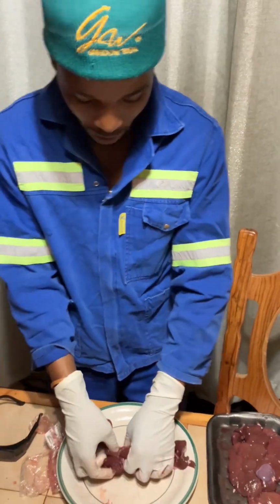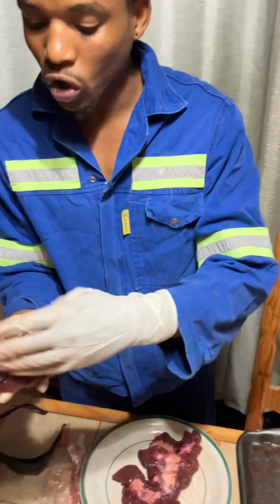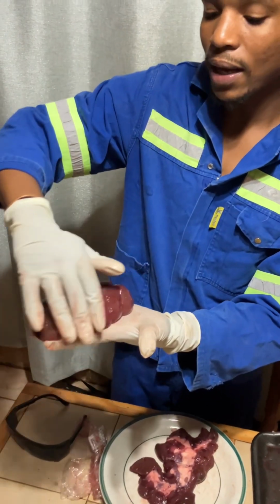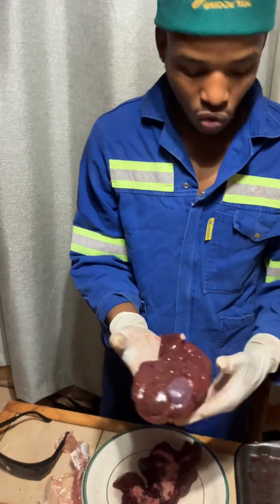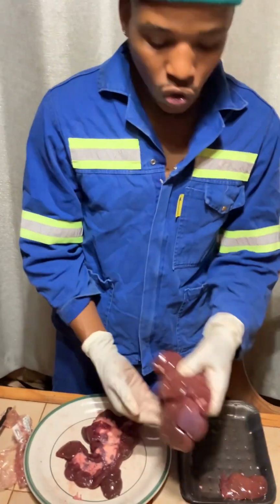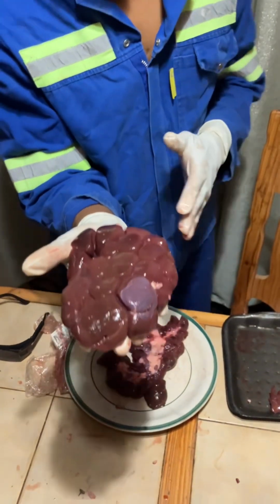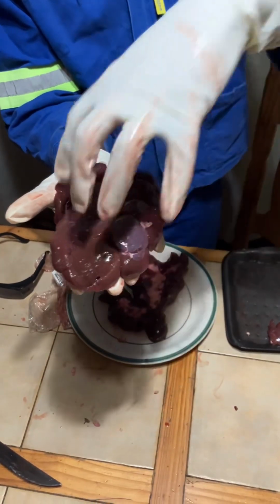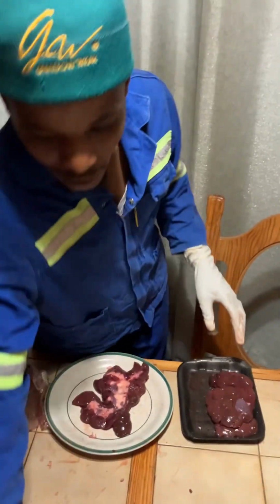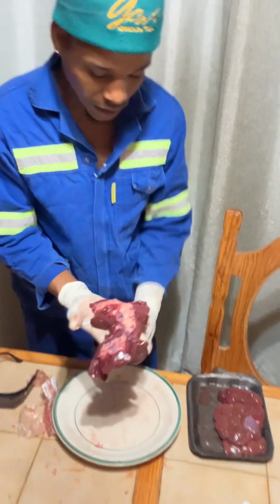All right, now the most outer layer part of the kidney is called the capsule. The capsule is the most outer layer part of the kidney and is also the one that gives the kidney stability. The capsule also protects the kidney from any possible injuries. So it's the one that makes sure that the organelles that are inside the kidney don't get damaged during injuries.